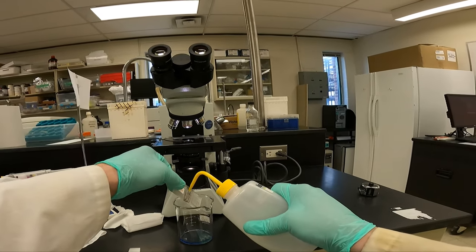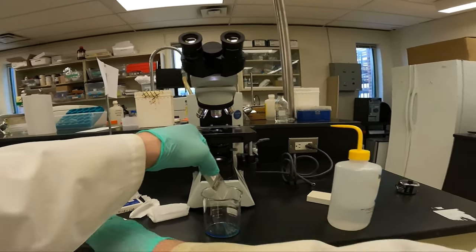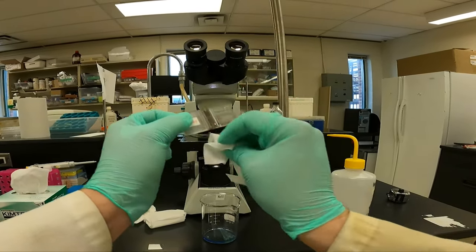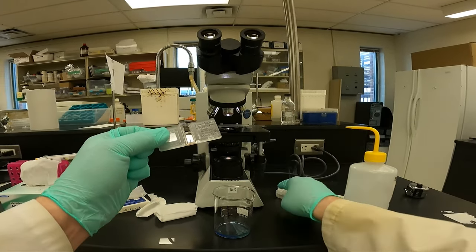We'll do the same thing with our hemocytometer. Wash it with isopropanol and wipe it down. Make sure you have a firm grasp. Do not drop this and break it.